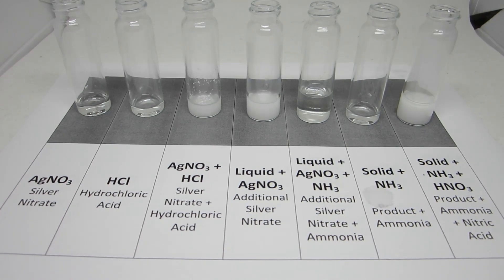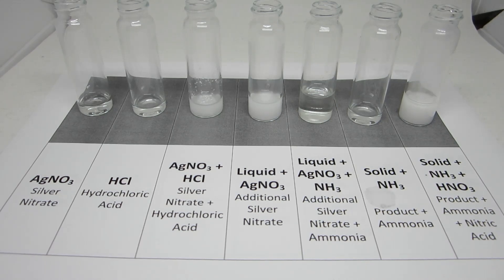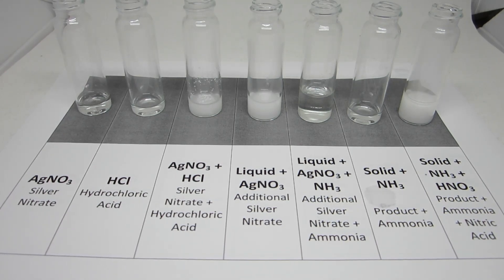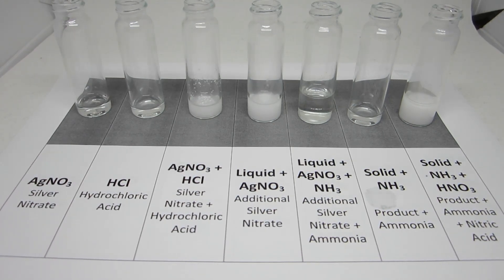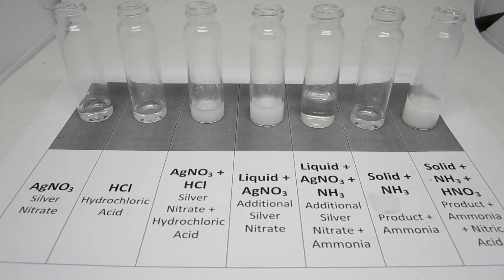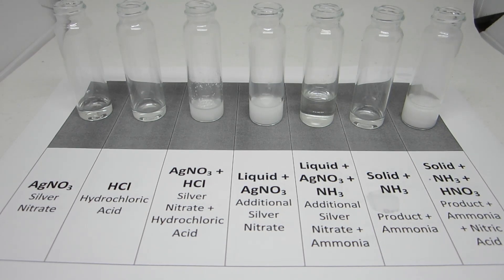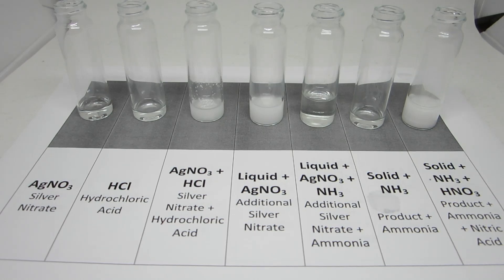With additional silver nitrate, more silver chloride precipitate forms. The precipitate itself is disrupted by ammonia and dissolves, releasing silver ions which bind to the ammonia. Last, the addition of nitric acid reacts with the ammonia to form the ammonium ion. This releases the silver back into solution where it can continue to react with chloride ions, resulting in the precipitation of silver chloride.